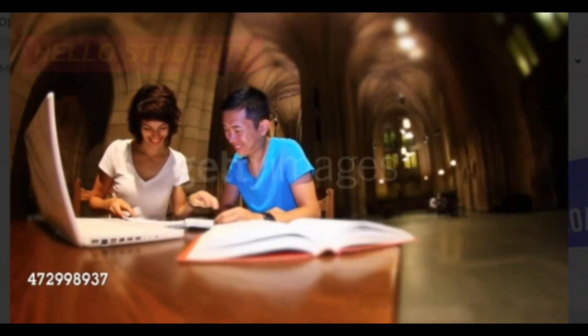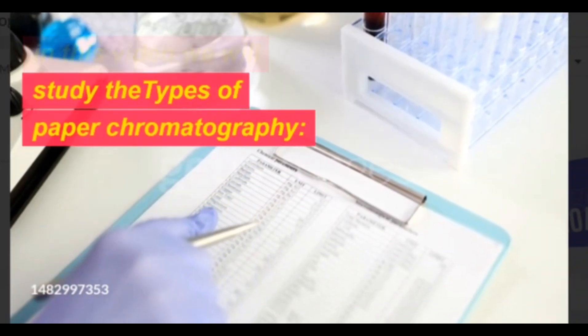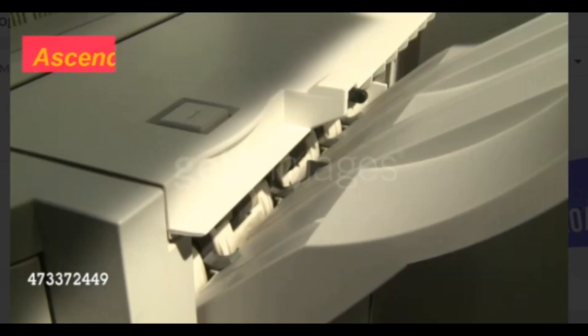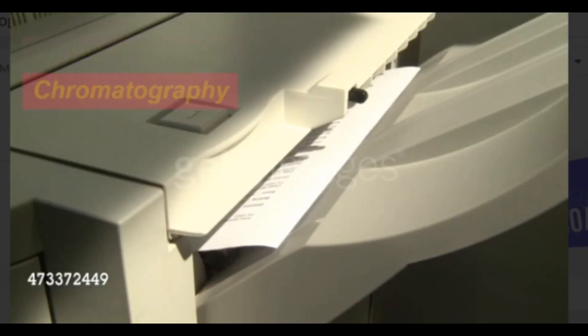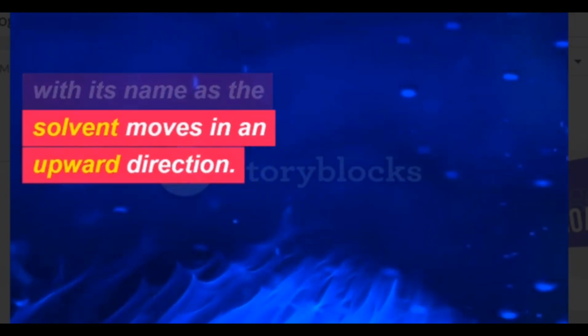Hello students. In this video we will study the types of paper chromatography. 1. Ascending paper chromatography. The technique goes with its name as the solvent moves in an upward direction.